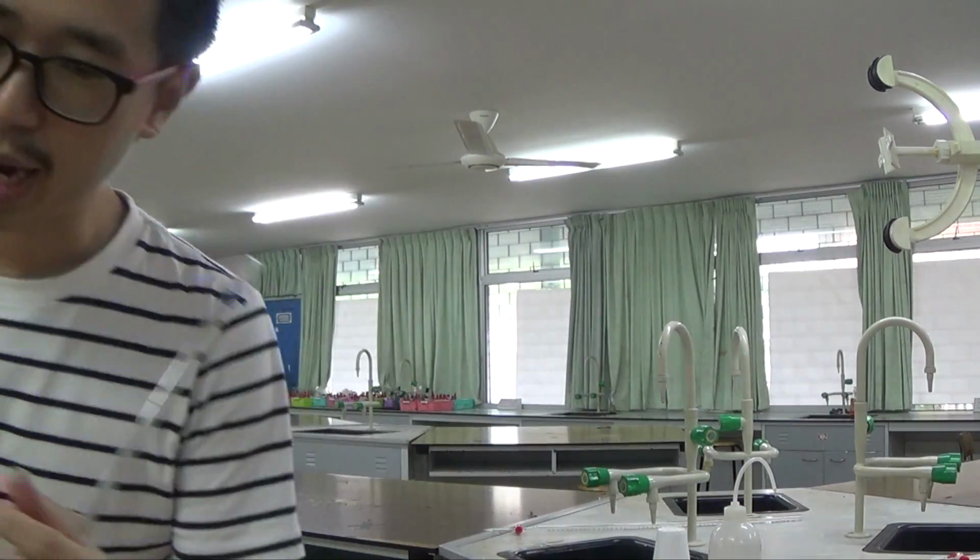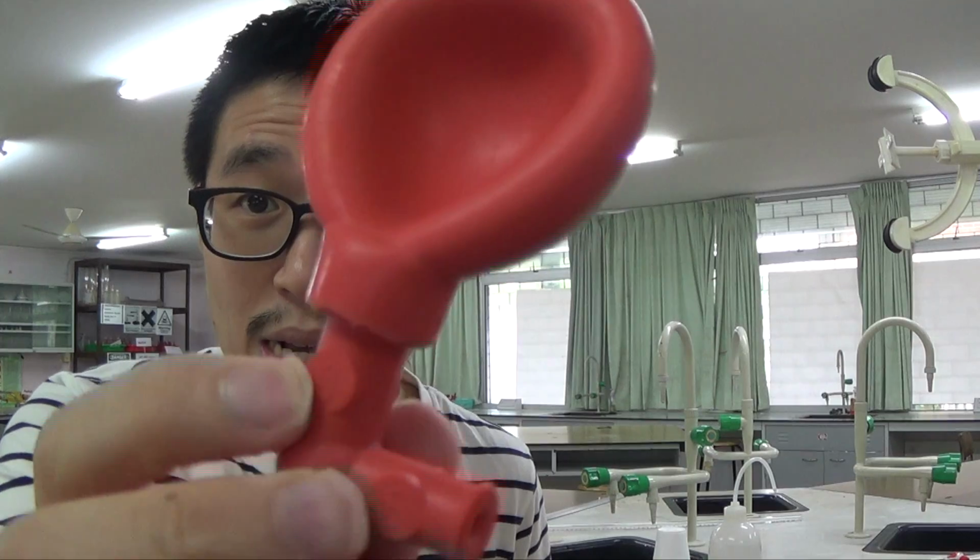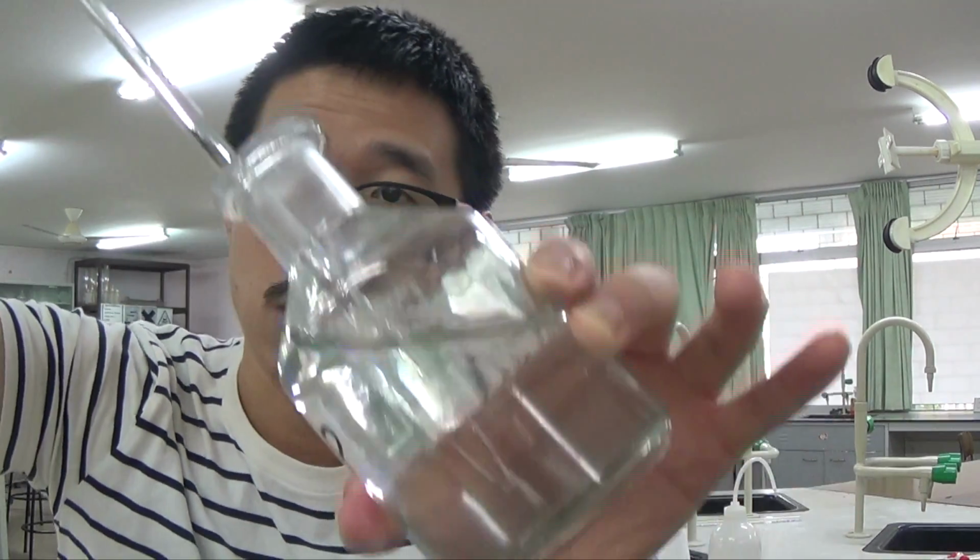Even when you are doing an actual titration, the usual titration with the indicator, you also have to do something similar. So it has the S and the E and the A buttons. The A basically is what you use in order to compress the air, and then you're gonna stick this empty pipette now into the solution and then press S, and then I usually personally prefer to do it at a slight angle, so I'm holding this at a slight angle. Somehow it just feels a bit faster, but don't know about you.